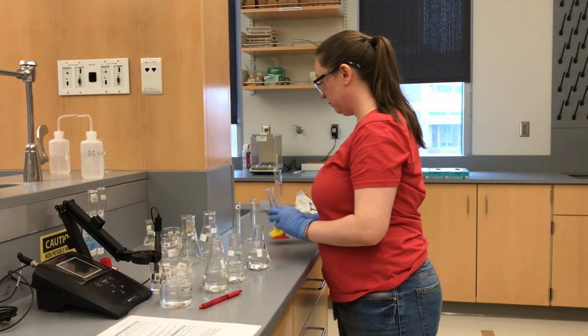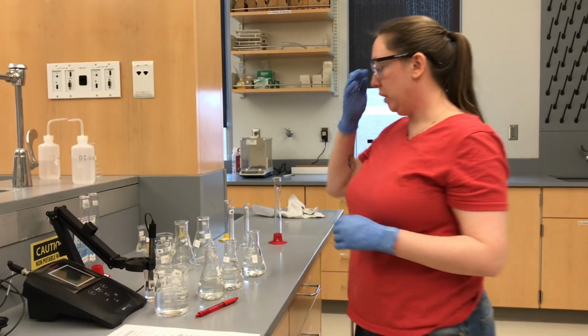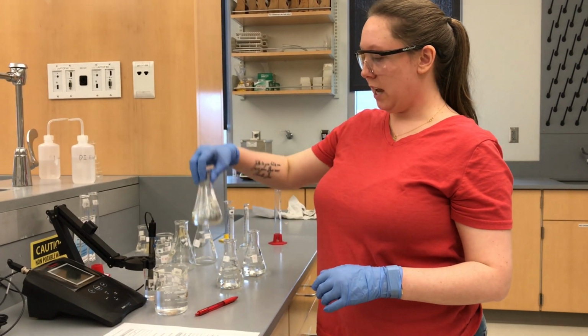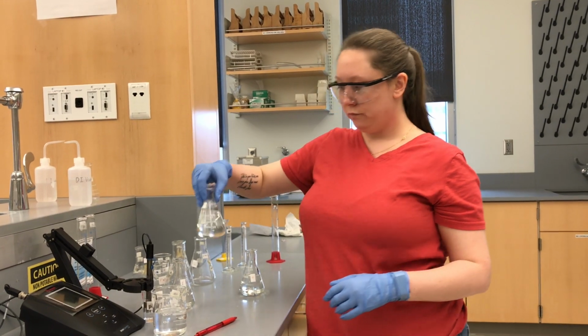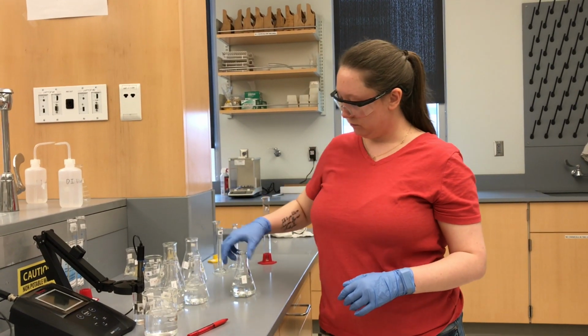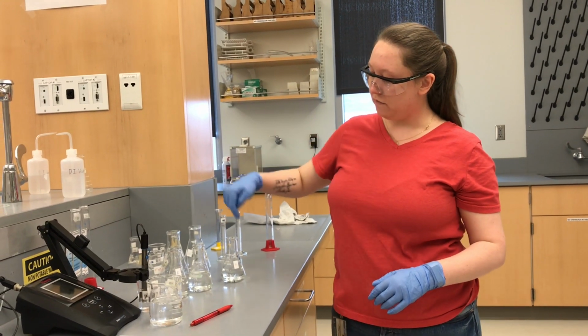Okay. So now we have E. I'm gonna give them each a little swirl. All right. So we have E, F, and G.